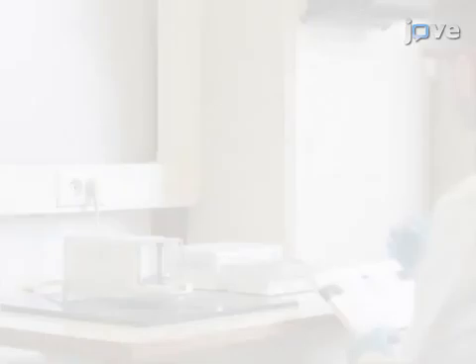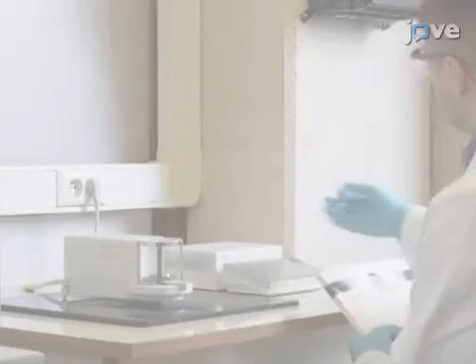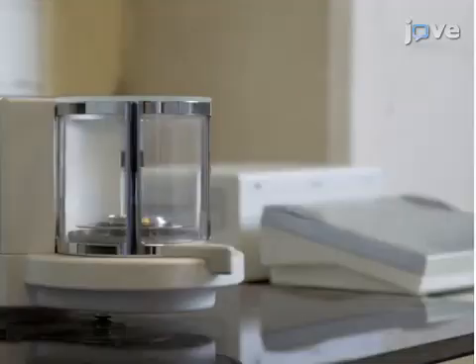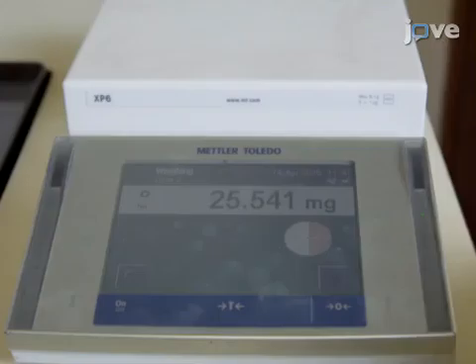To begin this procedure, weigh two glass vials using an analytical balance and note the measured values. Add approximately 25 mg of the internal standard, 2-chloropyridine, to the first vial.